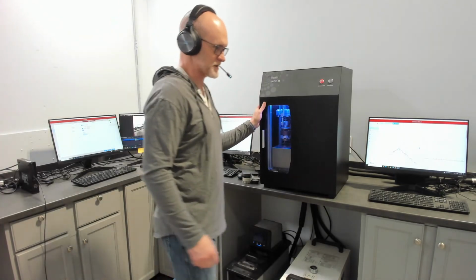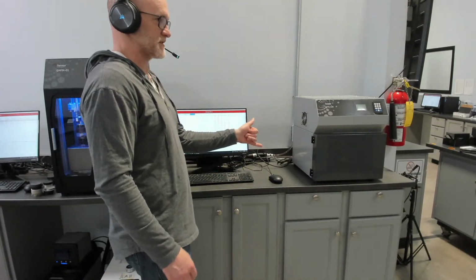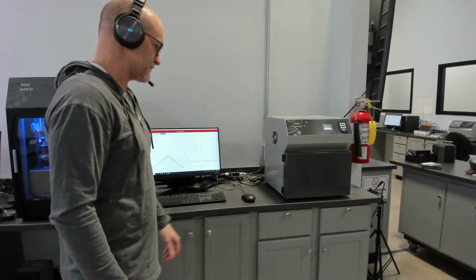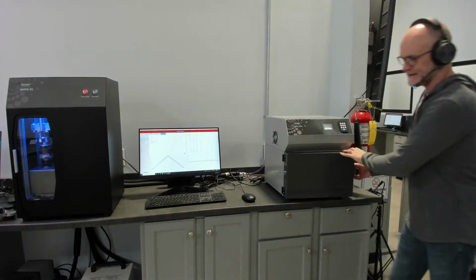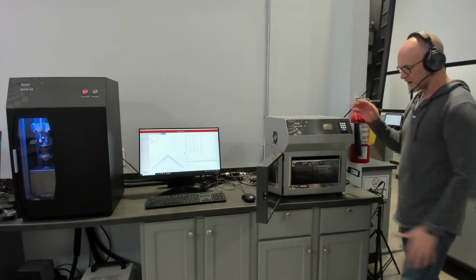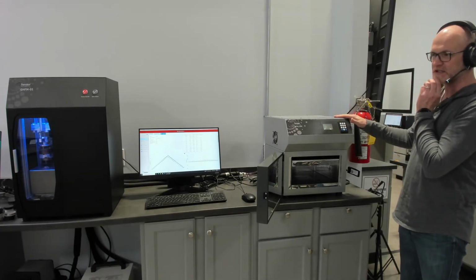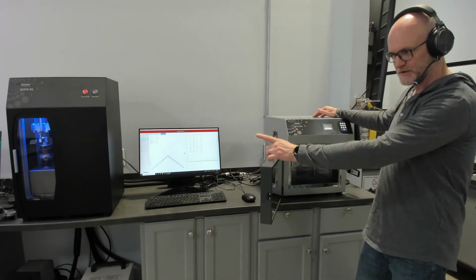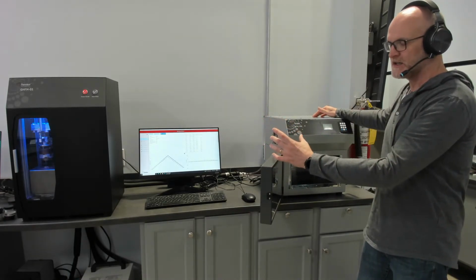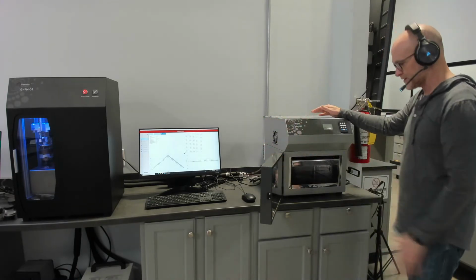This is our GHFM01. The other steady state method that measures thermal resistance and calculates thermal conductivity from that is our heat flow meter. So this is for measuring insulation and construction materials. I should say the thermal conductivity range for the GHFM01 is from 0.1 watt per meter Kelvin up to 100 watts per meter Kelvin. So it is specifically designed for conductive materials, and that's where that guard is rather critical.